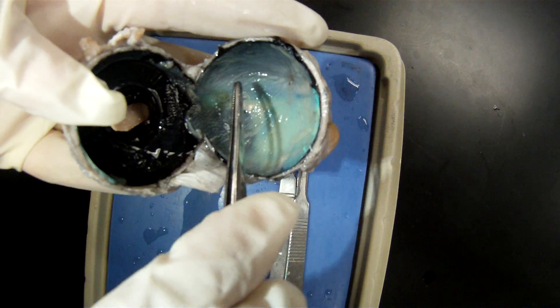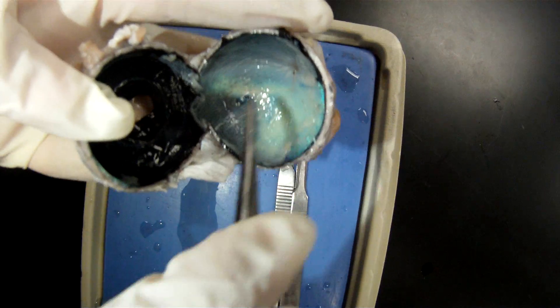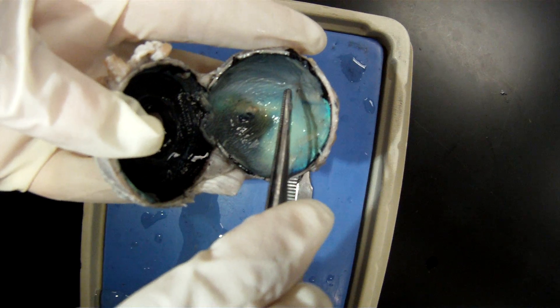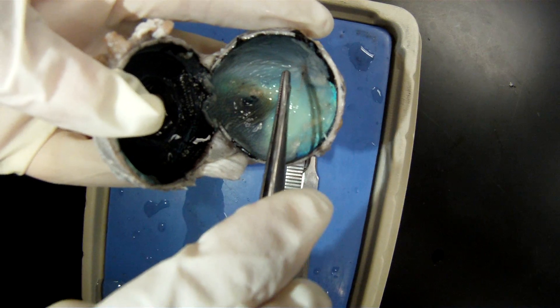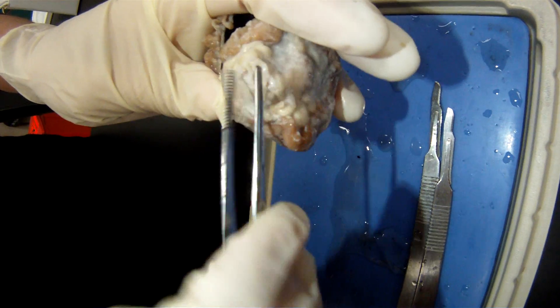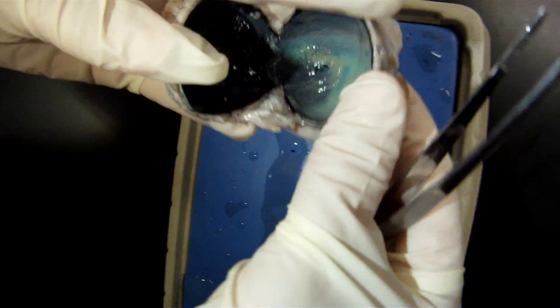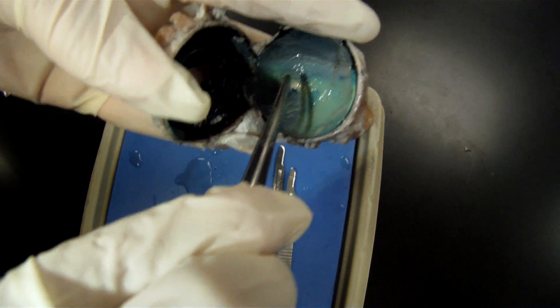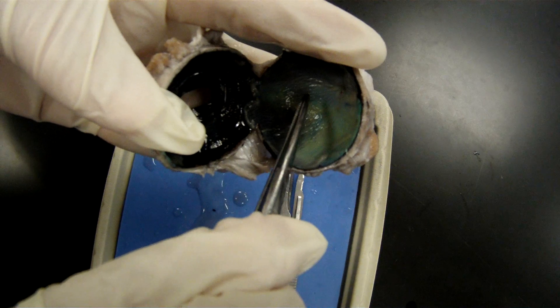Following the little strands on the retina to this point, the optic disc. And you follow that to the exterior of the eye. The optic nerve will be underneath this fascia of fat, and follow, go medial.